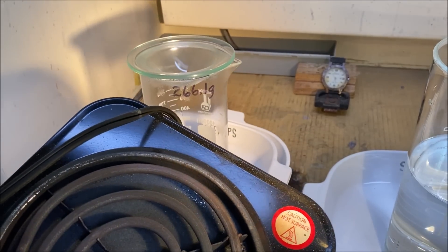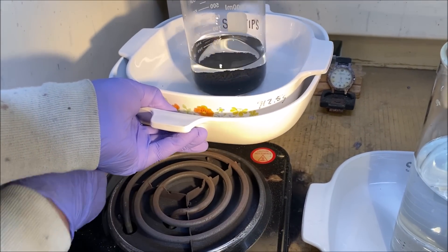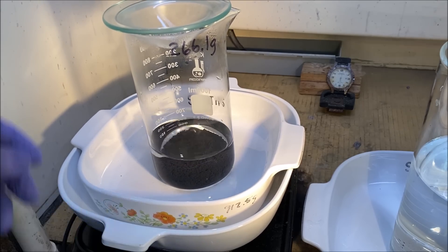Let's do a water bath here to dry off the metal so we can get a weight on it. Weight is critical for the next step.